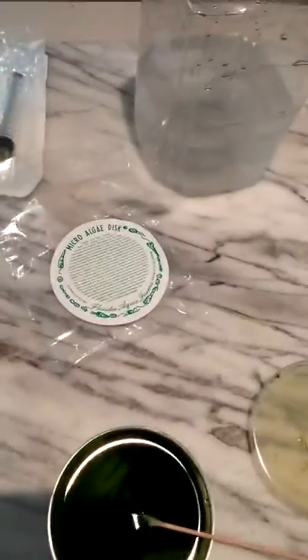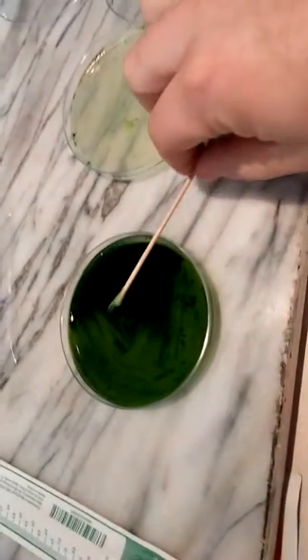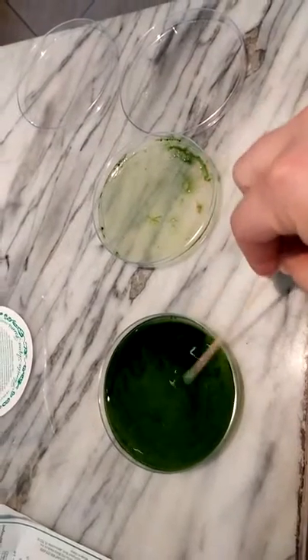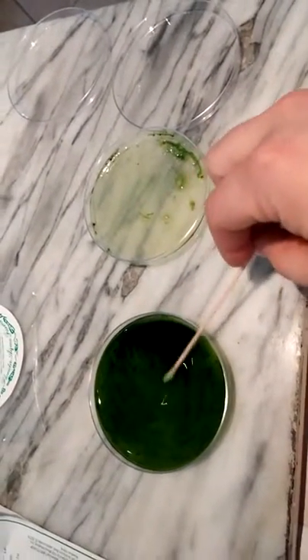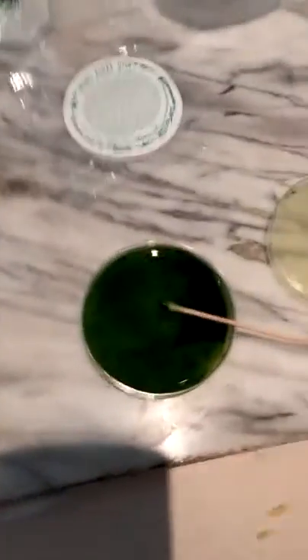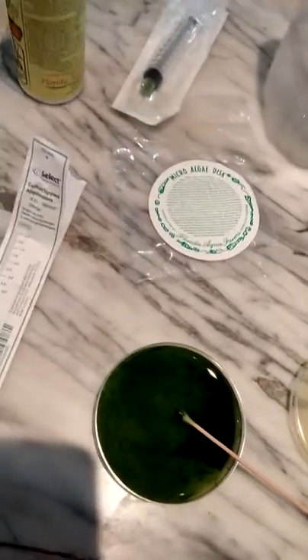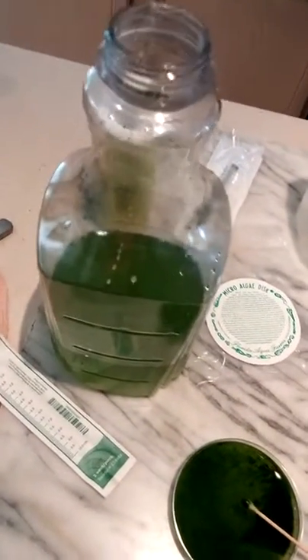The disc comes with a sterile cotton tip applicator. What you do is put sterile water on the disc and let it sit for 24 hours in moderate lighting — that's what the directions say. Mine has been sitting and I'm lightly rubbing the Q-tip and it's just coming right off the medium in the petri dish, becoming liquid. You scrub it lightly, turn it into liquid, and then get it into your container. I was happy to have access to some sterile syringes — I just pulled it up in a syringe and shot it right in without touching anything.